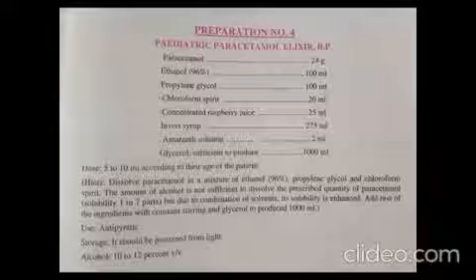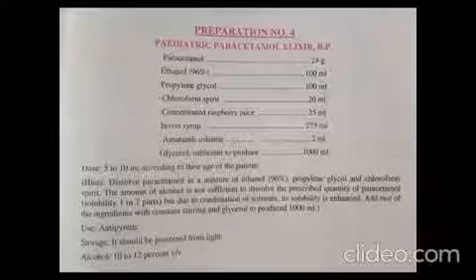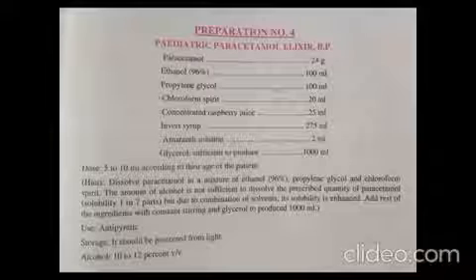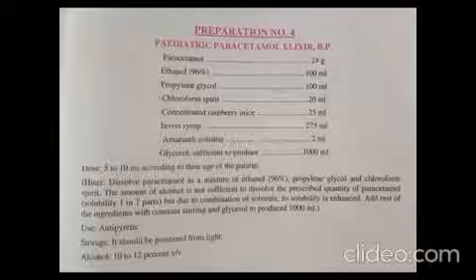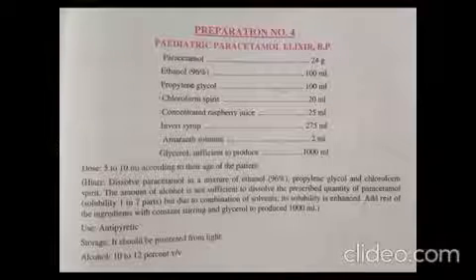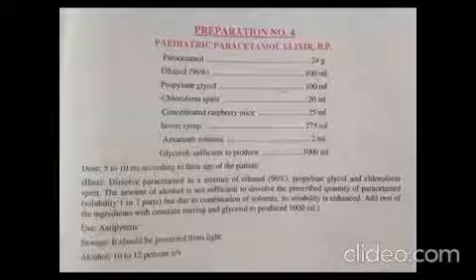Elixirs are hydroalcoholic solutions which are sweet in taste, containing alcohol and water. In this practical, we are formulating an elixir of paracetamol, which is an antipyretic drug, for pediatric patients — that is, for children.